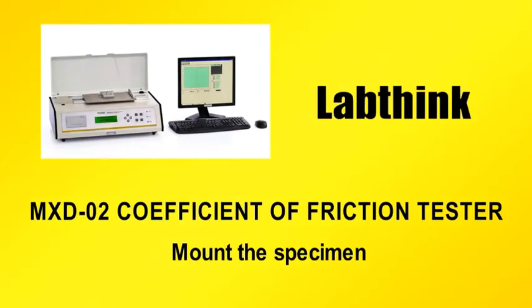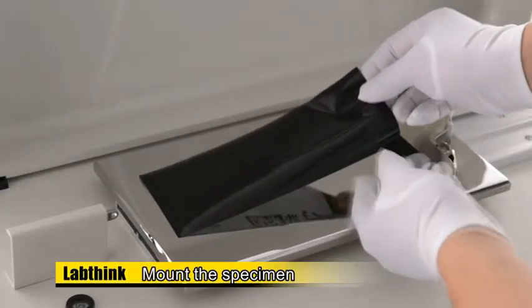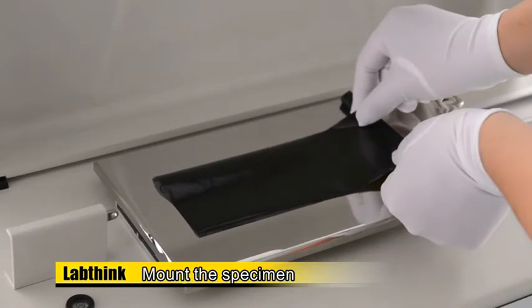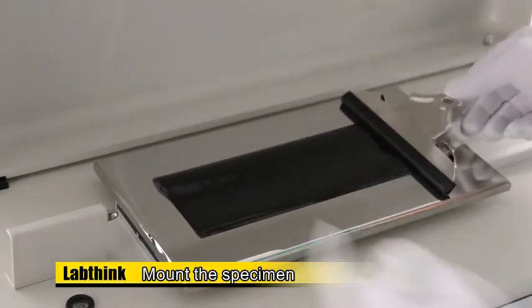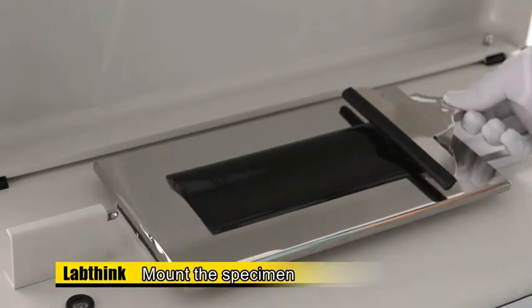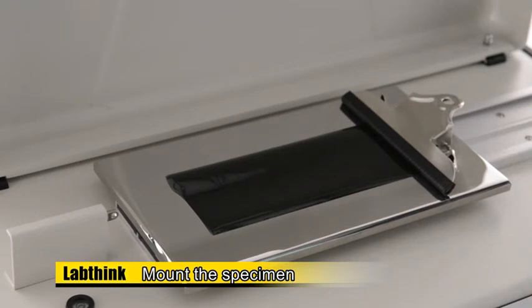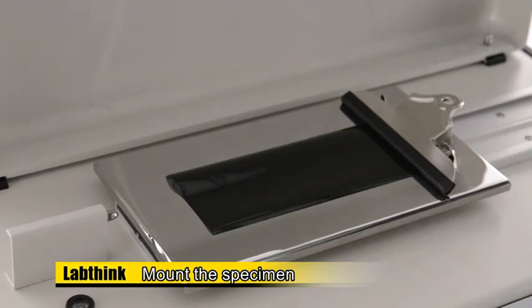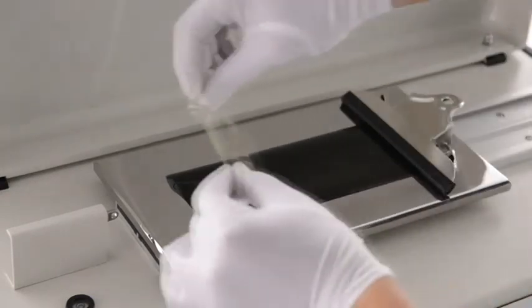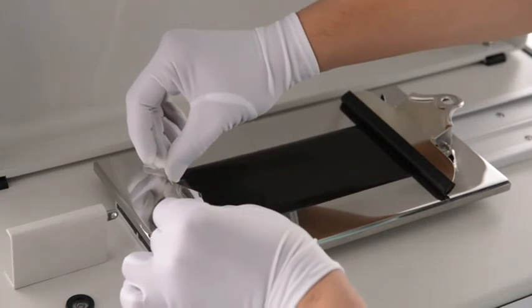Mount the specimen. Put the 200 mm × 80 mm specimen on the plane with the testing surface facing up. Lift up the specimen clamp on the right side of the plane gently and insert one end of the specimen into the clamp. Release the clamp to fix the specimen, making sure the length direction of the specimen is parallel to the machine direction of the plane. Tape the other end of the specimen on the plane if the specimen is curly.